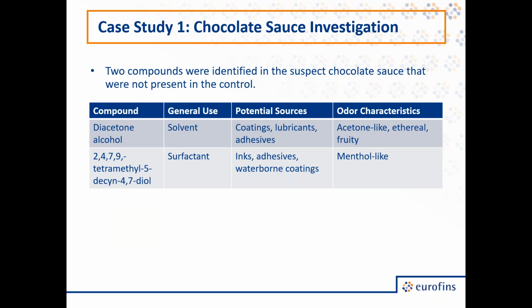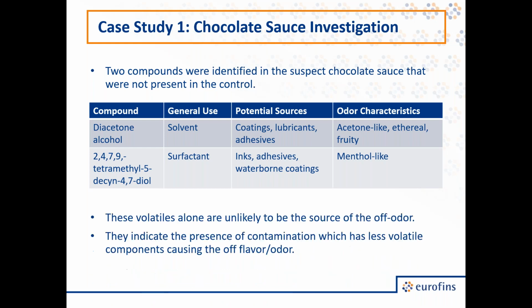So these two compounds were identified in the suspect and were not present in the control, and they also have many different potential industrial uses. So diacetone alcohol is a solvent. It can be found in many different coatings and adhesives, and it's known for having an acetone-like or ethereal odor. And tetramethyldecynediol is a surfactant. It can be found in inks, adhesives, and waterborne coatings and similar types of things, and this is known for having more of a menthol-like off odor.